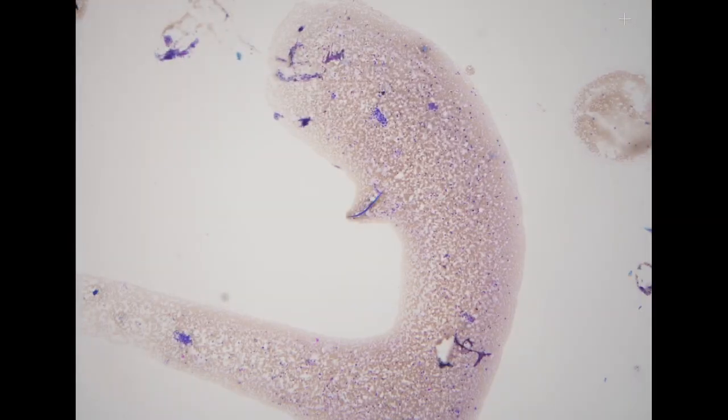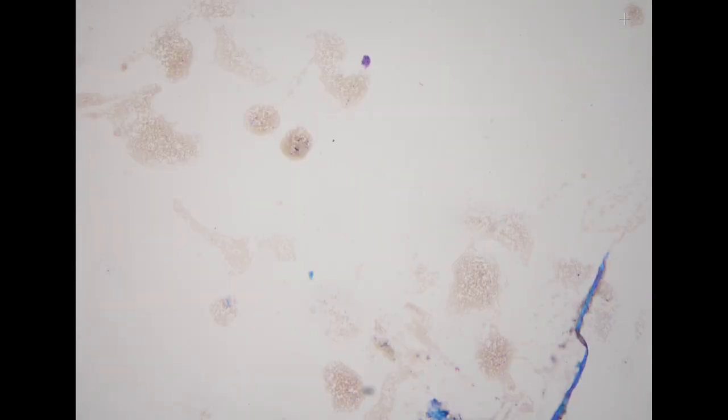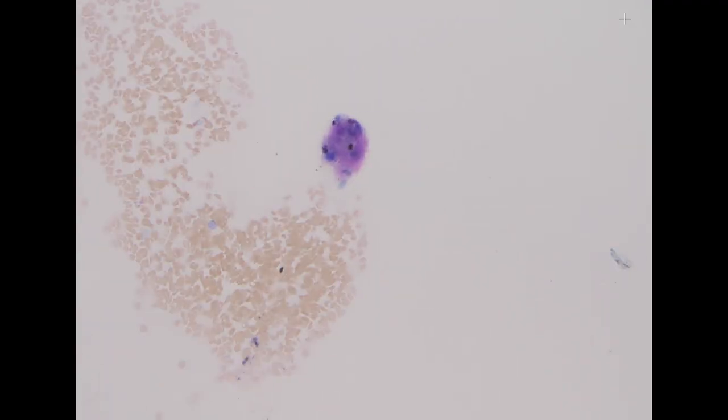For the pleomorphic adenoma, this is the direct smear. For the Giemsa-type staining, or what we perform here is Diff-Quik stain, we would like to see this type of fibrillary, magenta-colored matrix closely intermingled with the myoepithelial cells. This is very typical for pleomorphic adenoma. In this specimen, the stroma is very, very scant, but we can still definitely see some stroma. So this is a benign pleomorphic adenoma, which is the most common salivary gland neoplasm that we see in our practice.